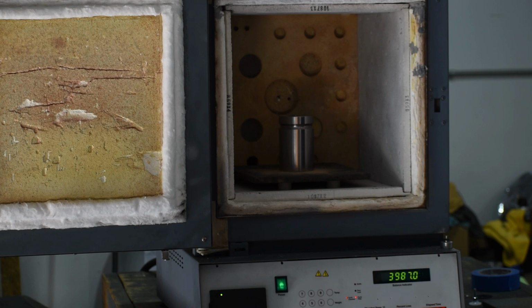We found more of these hearth plates this year than we ever have. And I get it. They're probably cheaper than the correct hearth plates. That's why we developed a stainless steel hearth plate, one that shouldn't break and you should never have to replace.